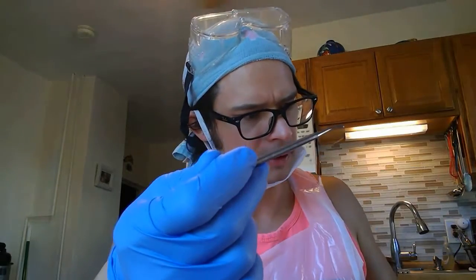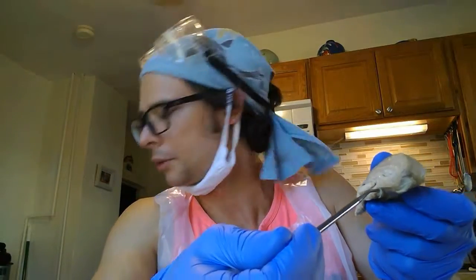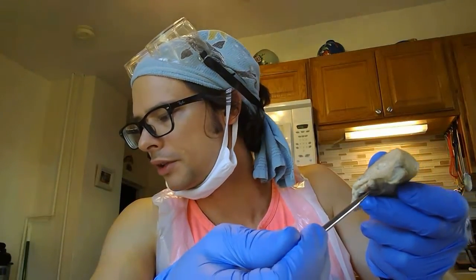So here's the cerebral cortex, white matter, corpus callosum, thalamus, and then there is right here as part of the midbrain. There's a bit of a pineal gland, and I also got some mammillary bodies. I believe this is a pituitary gland. A little bit difficult, I'm looking using the sheet here.